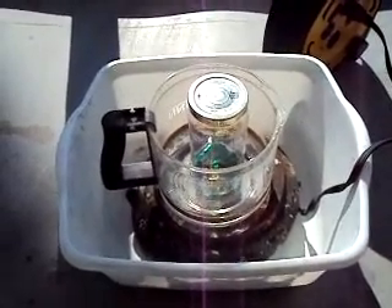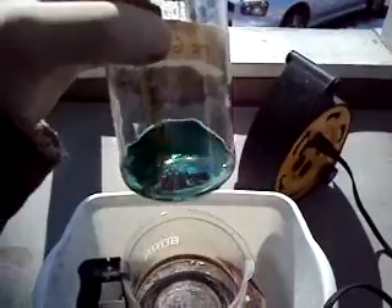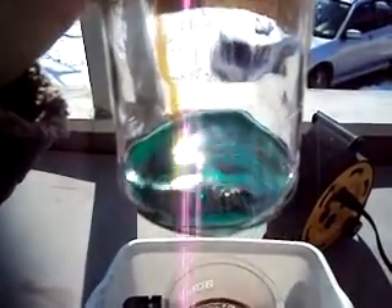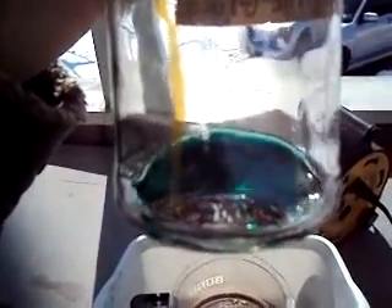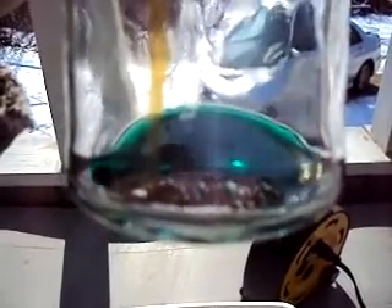I am back. It's been about ten minutes since I last had the camera on. The reaction has substantially subsided. About a minute after I last had the camera on, some red fumes started to evolve. So what I did was I put a tiny swig of the 35% hydrogen peroxide in, and it once again suppressed the red fumes. The reaction has pretty much stopped, so I'm going to add a little bit of heat. From what I can see, this has definitely dissolved a great portion of the copper wire — it's much thinner than what it started out as. I'm going to let this sit and heat up for a while and then do the final weighing.